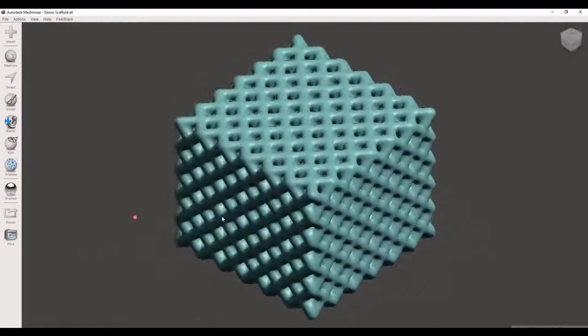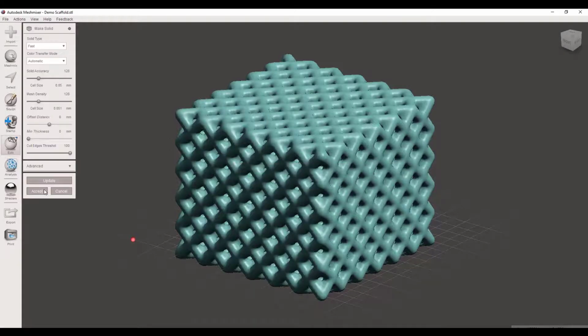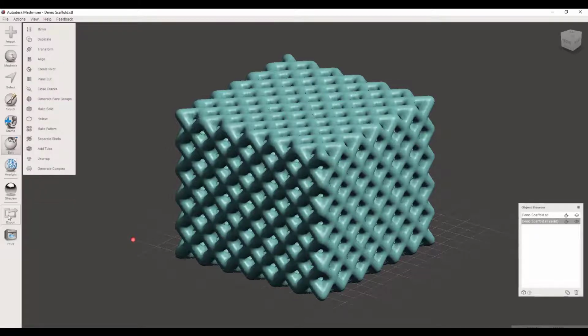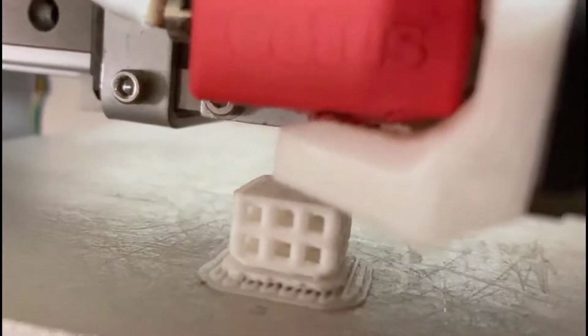Okay, here is the scaffold back to normal. Now let's click Edit, Make Solid, and now we wait for Meshmixer to check and optimize the geometry. Then click Accept. Okay, well, now we can export our file in STL format, ready to be 3D printed. Okay, now I'm trying to 3D print this scaffold with a very cheap, very small, but very promising 3D printer.